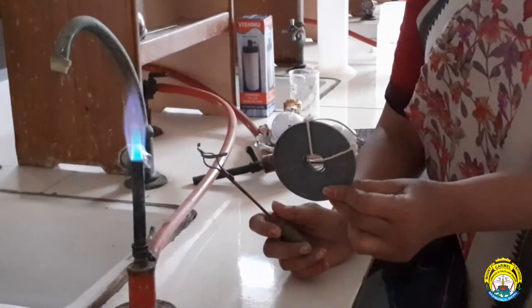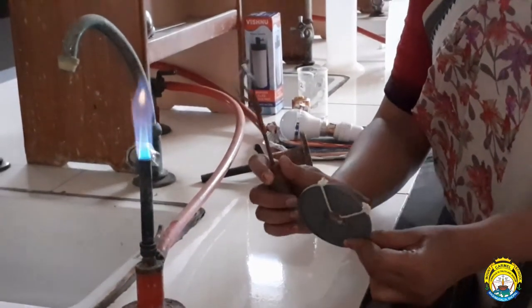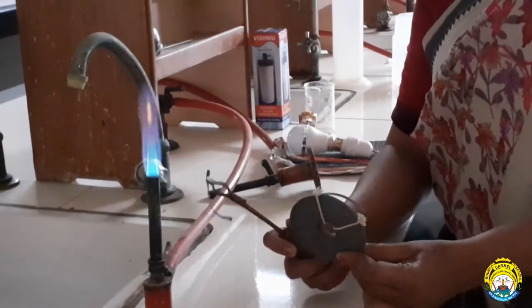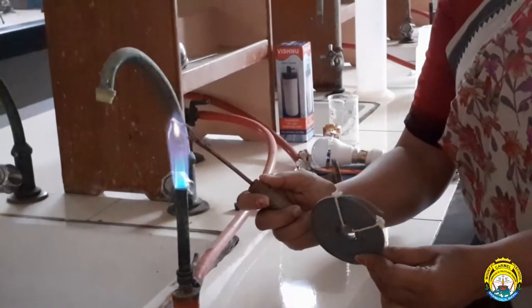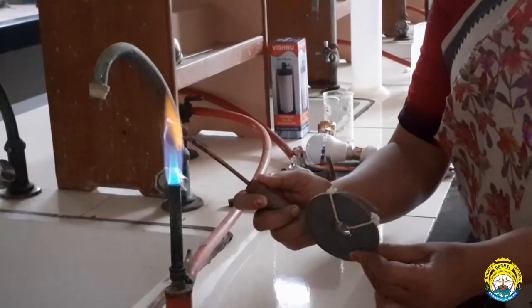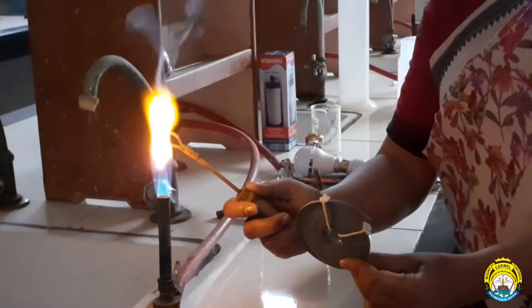This is a bunch of magnesium metal wire and I have taken a small piece of it in my hand. Now I am going to heat it in the flame of a Bunsen burner. Let us see what is going to happen.